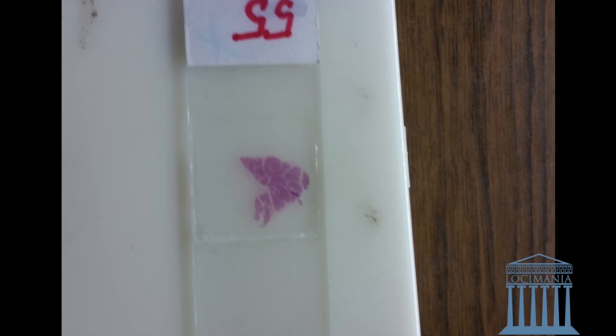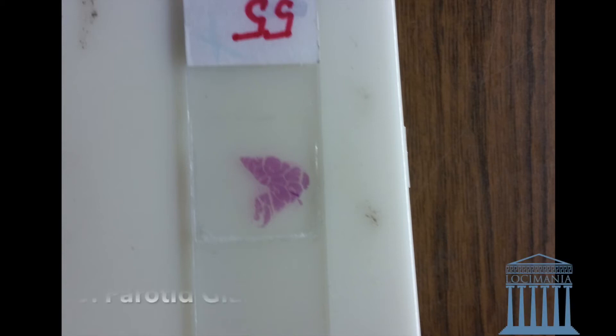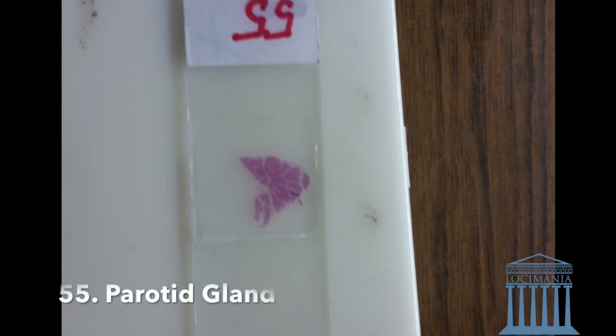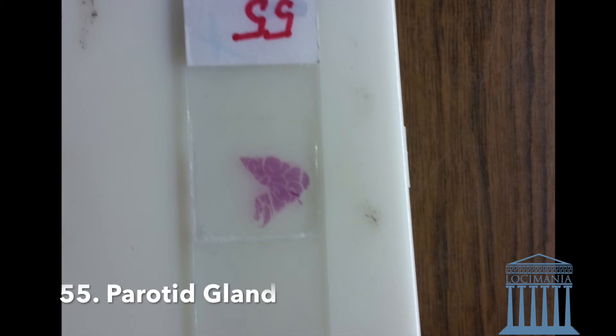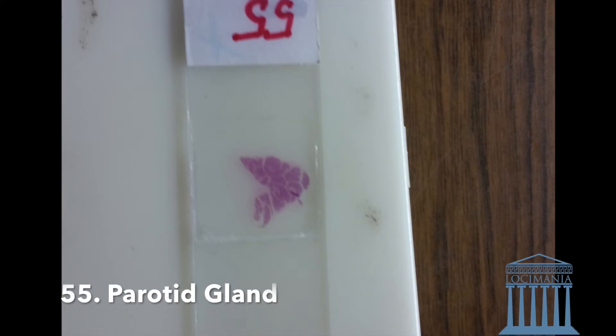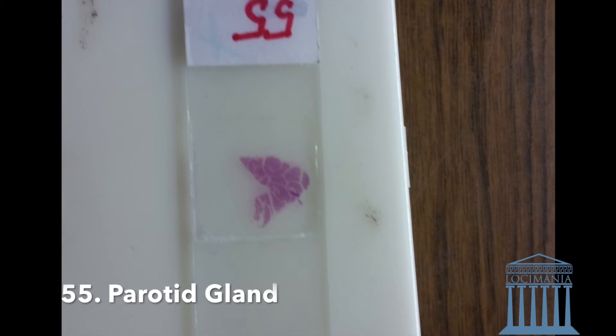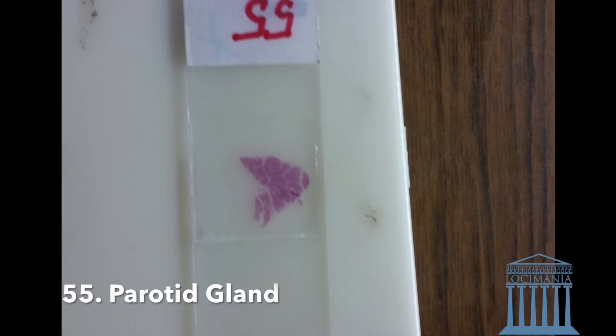Hello and welcome to Loci Mania. We have slide number 55, which is the parotid gland. This is a part of the salivary glands. So what do we know about parotid glands?